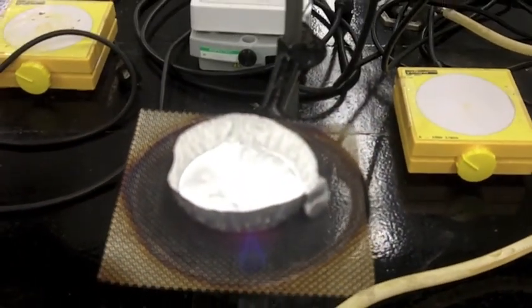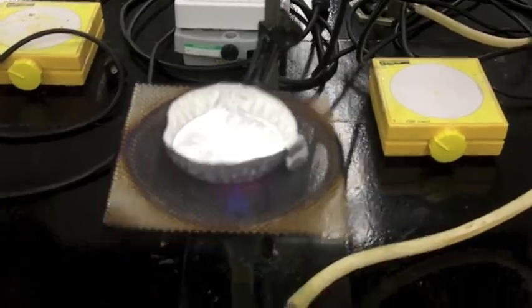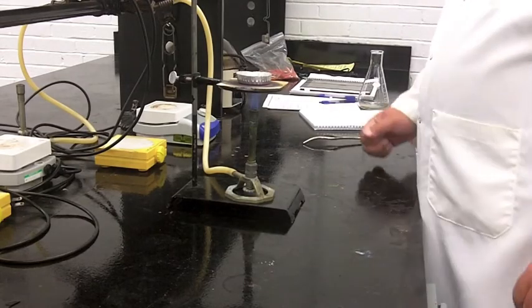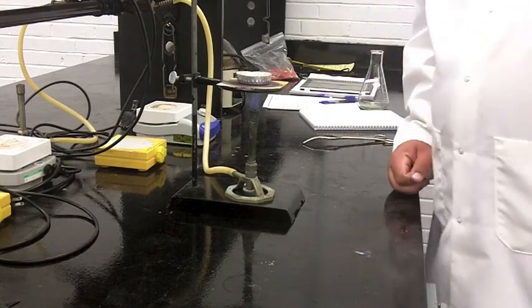Once you get your glowing orb the way you want it, you just go ahead and put the pan on to the burner and you wait. You can shuffle a little bit, but it's probably going to take somewhere around 10 to 15 minutes for this to heat.